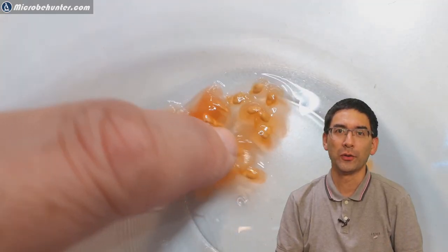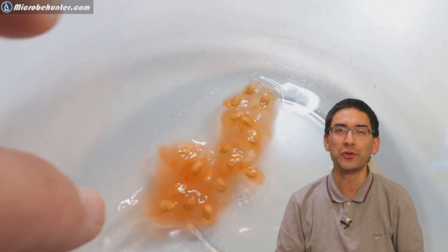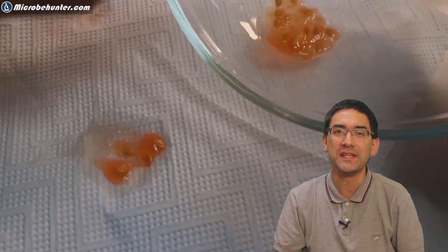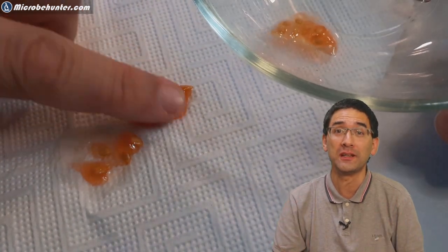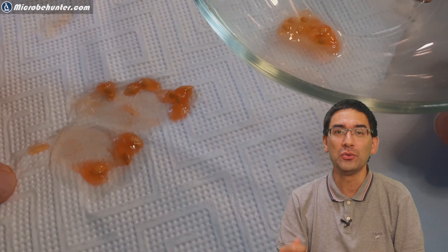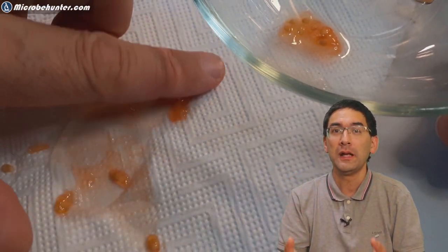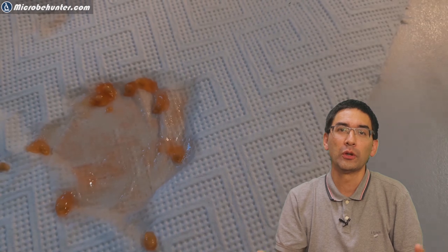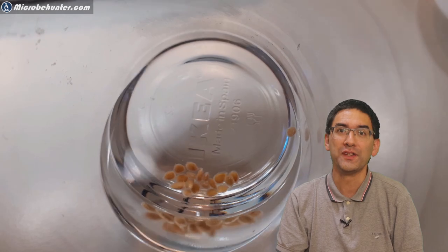For growing your own tomato plants, you have to collect the seeds first. The first thing you have to do is remove the jelly-like pulp from the seeds. That's really important, otherwise the seeds will not start to germinate. The easiest way to do that is to use a tissue paper and simply rub off the pulp, then put the seed for a day or so into a cup of water. The water will flush away the remaining chemicals that inhibit the germination of the seed.